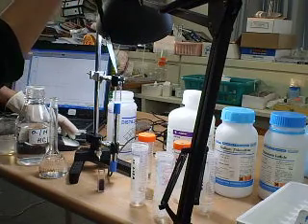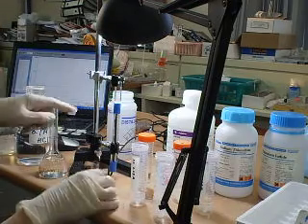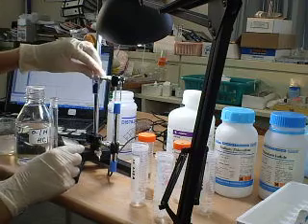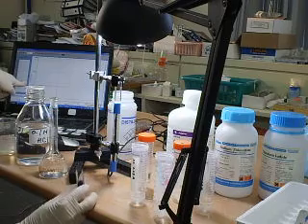1 ml, start my data collection. Once blue-black coloration forms, the light intensity will drop and it will be recorded on my data logger.